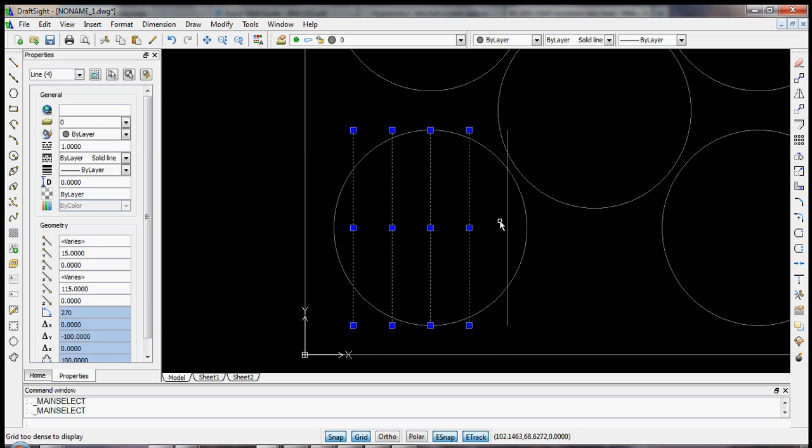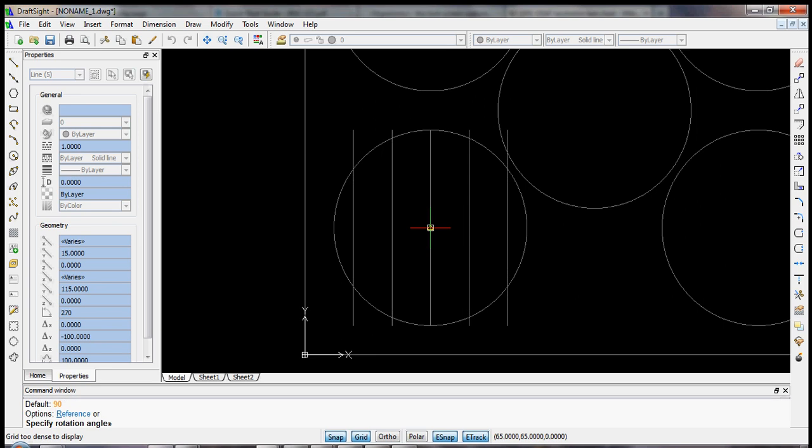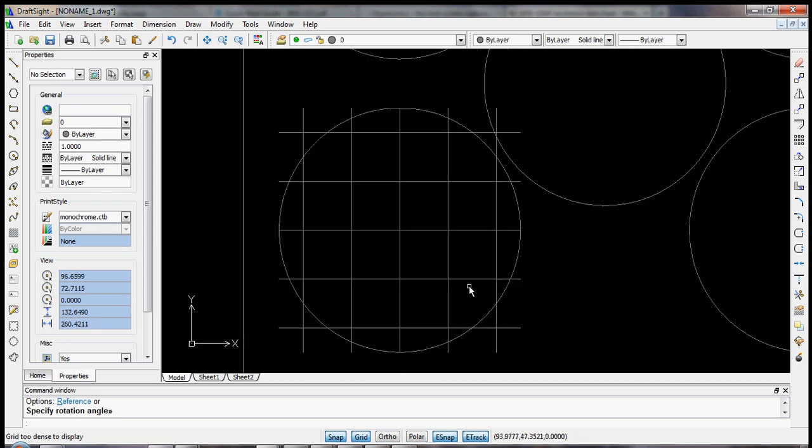to select one group of them, and then we'll select rotate. We'll select the center of the circle and some vertical position. Okay, so now we have a nice grid. And what you see here is that we have 1, 2, 3, 4, 5, 6, 7, 8, 9, 10, 11, 12, 20 by 20 millimeter squares all fitting nicely and using up most of the area of this 4-inch wafer.